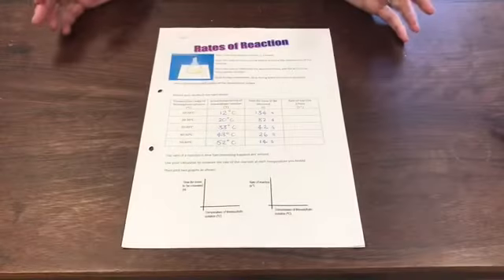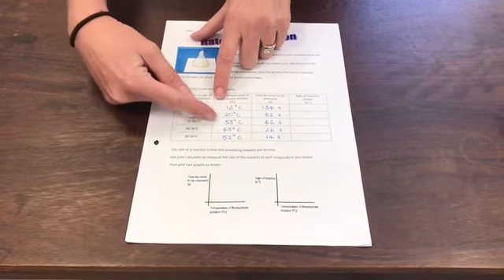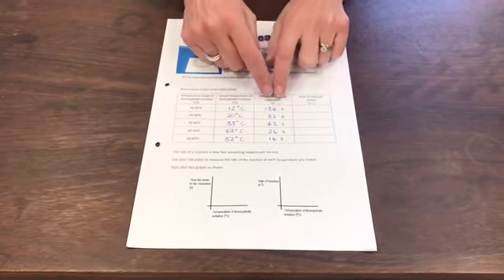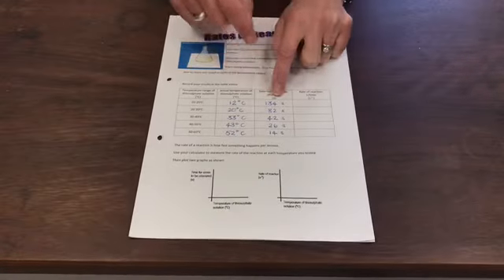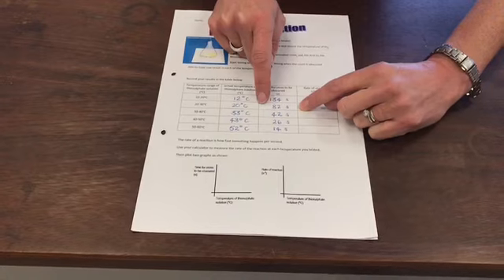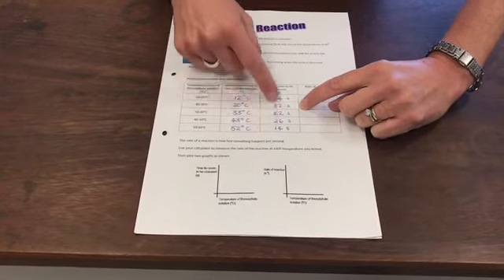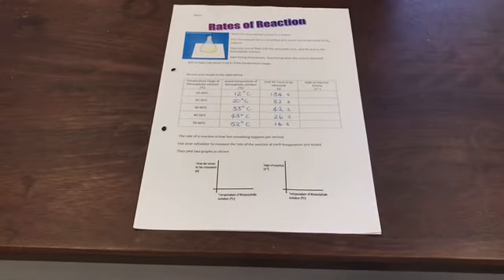Okay, so I've finished the experiment, and this is the data that I got, the results that I got from the experiment. So you can see all the different temperatures that I tested and the time that it took for each of those reactions. Now, this was the one I did first of all that was being filmed, and you saw that it took 1 minute and 22 seconds, but you can see where I've recorded the data here, I've converted it to seconds, so all of my data is recorded in the table in seconds.